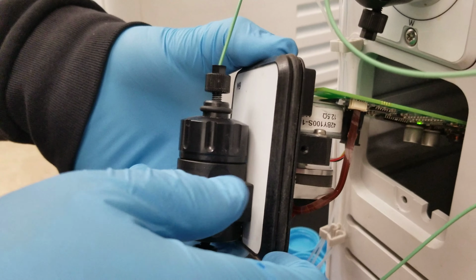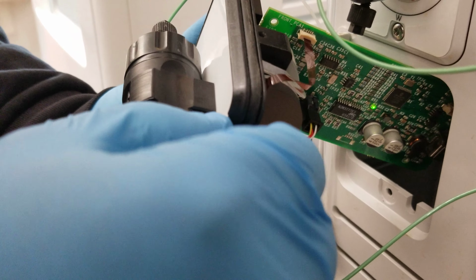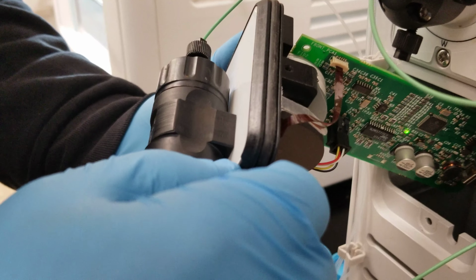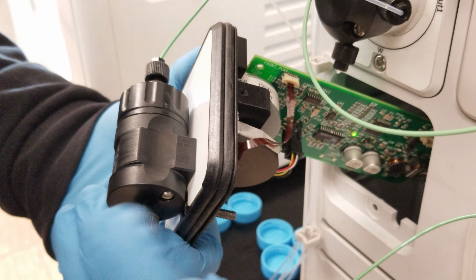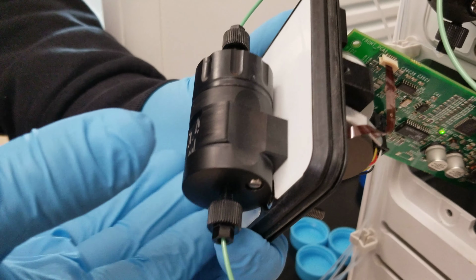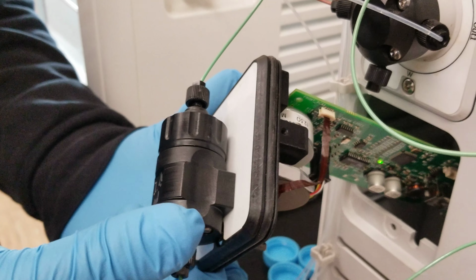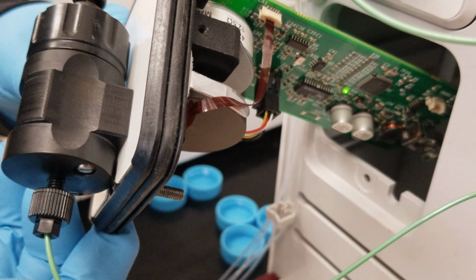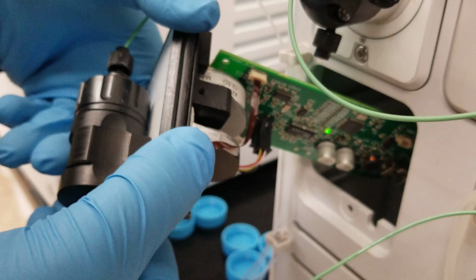Yeah. I thought everything would stop. Huh. So maybe it's not a good idea to leave this thing at pause for a long time. Maybe. I don't know, I can feel it moving. Maybe that's what causes the noise. What's moving? If you can feel, or you can see it. But look, this thing is consistently moving, so we should not leave this thing on when we do this equilibration.